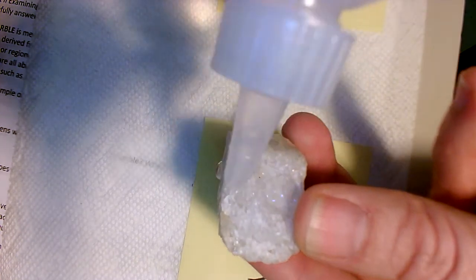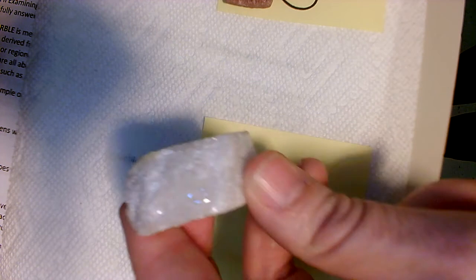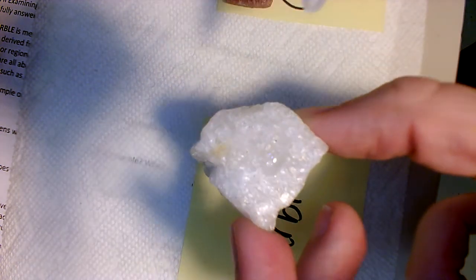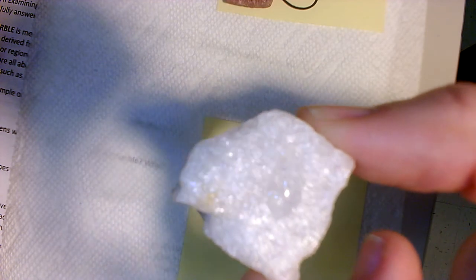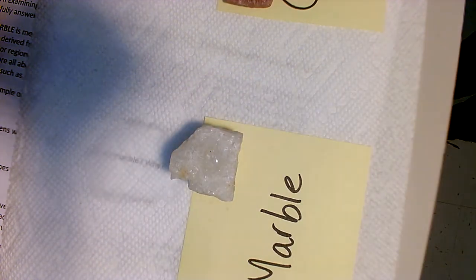So far I haven't seen too much fizzing but I'm trying a different side here. The fizzing is not as vigorous with marble as it would be with the parent rock of limestone.